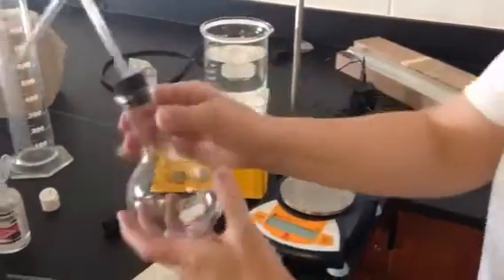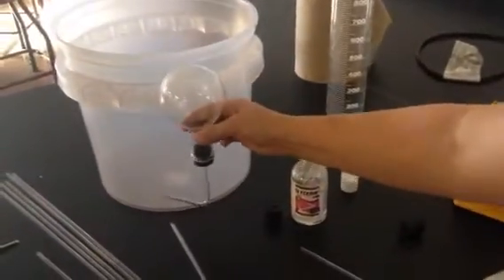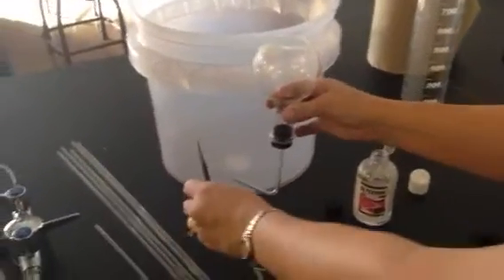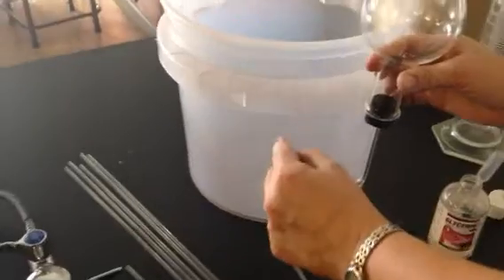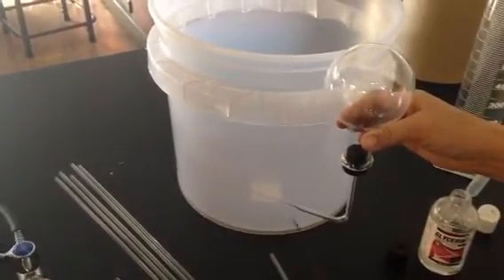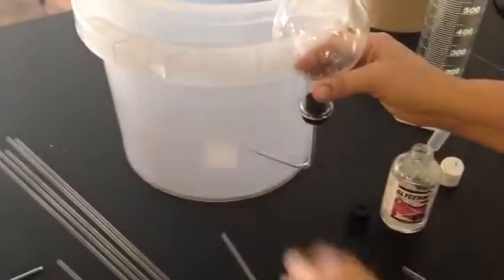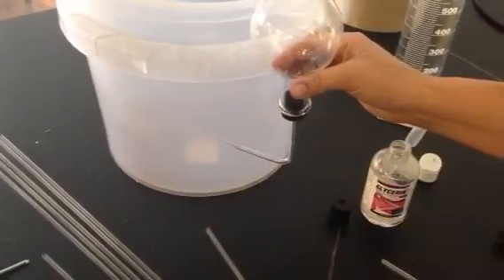Then you're going to invert it in a bucket of water. Like inside the bucket it'll look like this. And you're going to take your file and try to break the end of that little sharp piece of glass off under the water. Not with your fingers. Push it against the edge of this. It's relatively easy to break if you get your glass pretty thin.